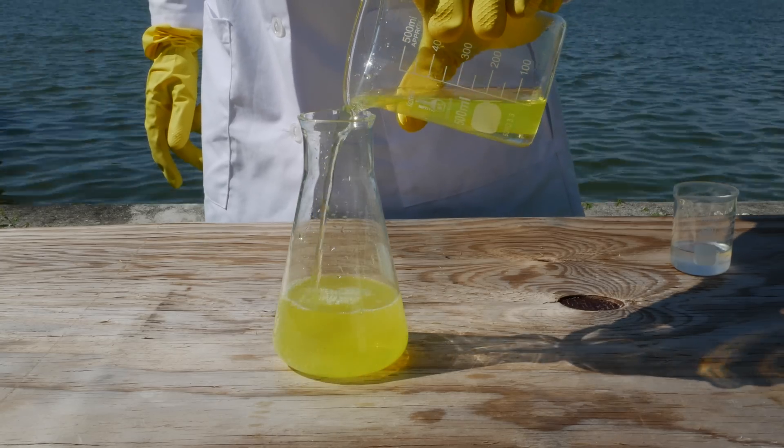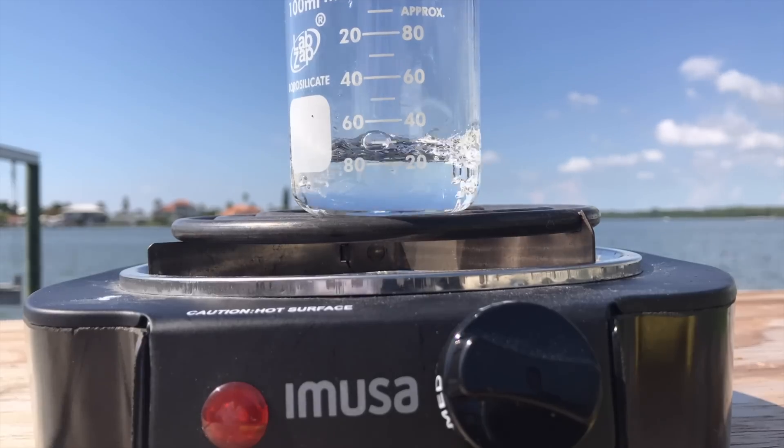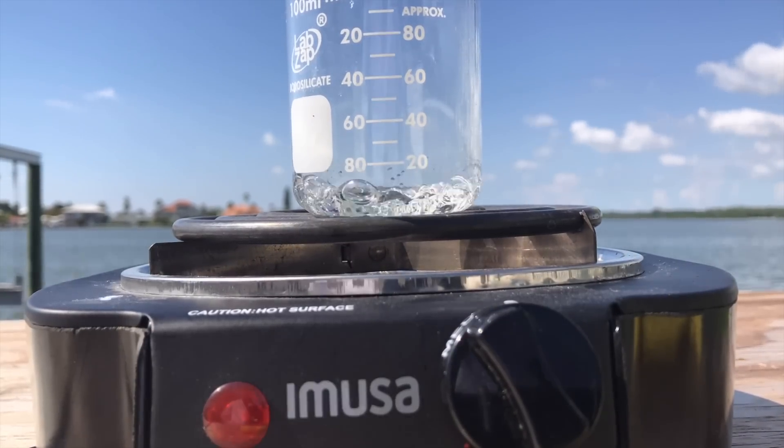So now that I was very careful in mixing, we can separate our methylene chloride from our decaffeinated Mountain Dew and repeat one more time just to get as much caffeine out as possible. Finally, we have our caffeine-filled methylene chloride solution, and all we have to do is evaporate it out on a hot plate. And after a cool time-lapse, we have our caffeine.